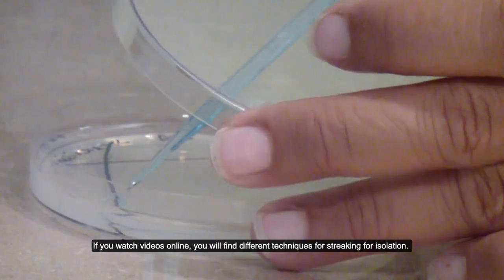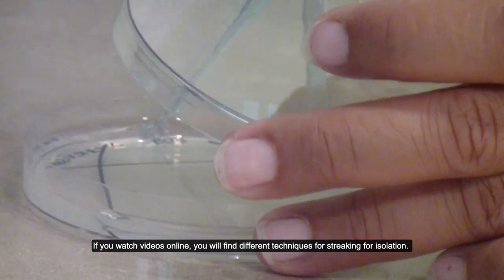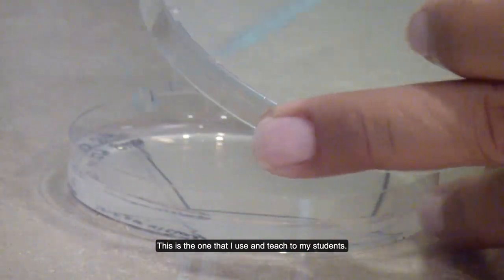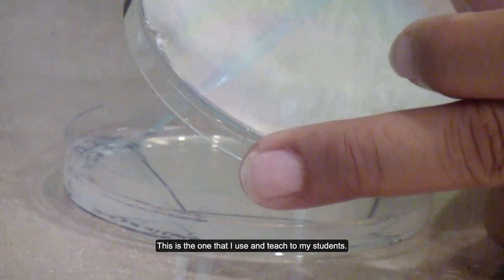If you watch videos online, you will find different techniques for streaking for isolation. This is the one that I use and teach to my students.